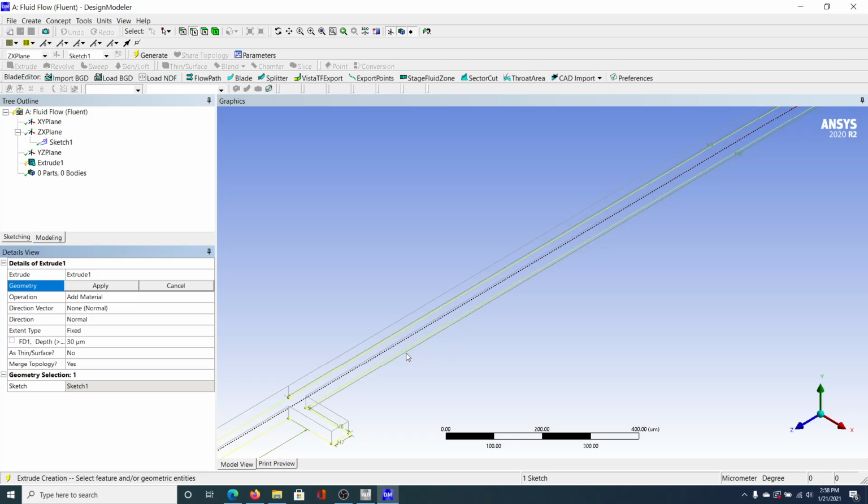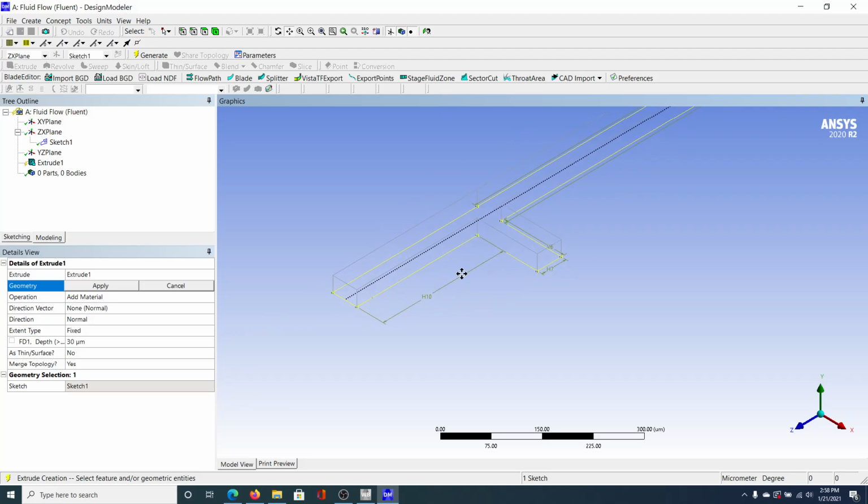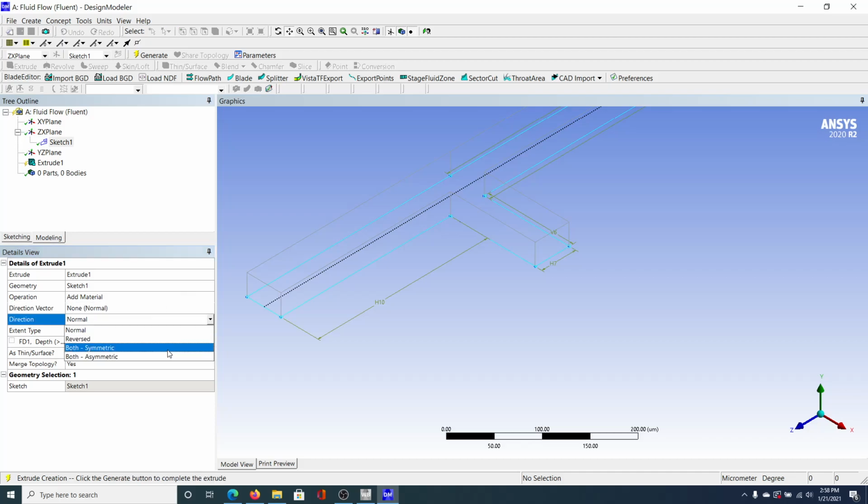And you can see here that we've already, so I've already created somewhat of an extrusion that you can see, but we want it to be even because remember we want this z-axis to be right in the middle of the channel. So what we're going to do is for the geometry, we're going to click the sketch, click apply, and that's basically applied sketch one as the shape we're extruding. We're adding material. Direction, we want to be both symmetrical. So we want a symmetrical direction, which means it's going to go up and down, fixed.